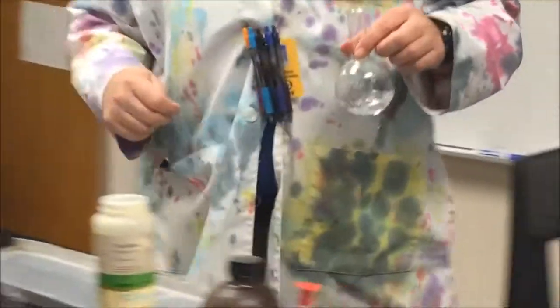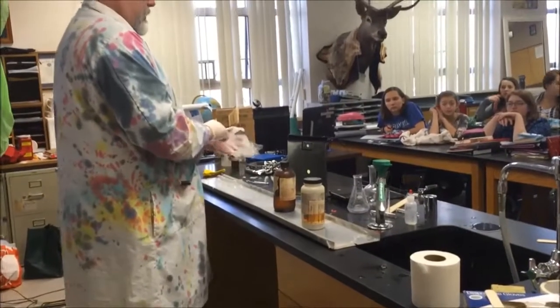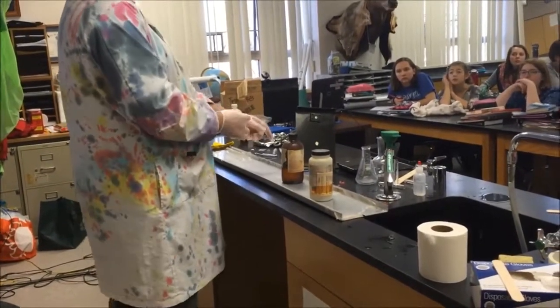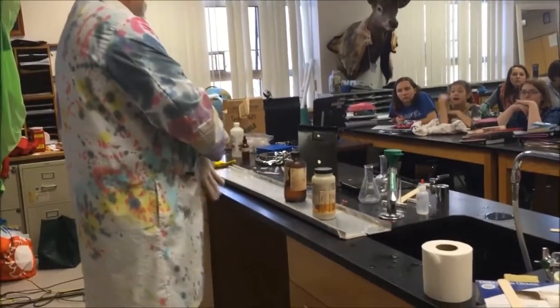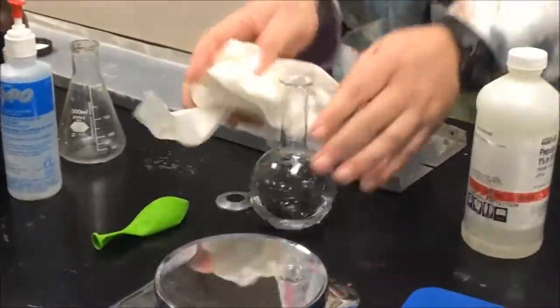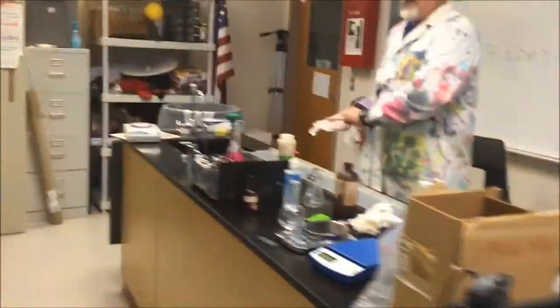The next thing I'm going to do is I'm going to add a really super duper ridiculously strong acid. Strong acid. Can I smell it? If you were to smell it, you should use what technique? Wafting. That's right. This stupidly strong acid is called hydrochloric acid. It's in your stomach. I have gotten like a full face of hydrochloric acid vapor — it was not pleasant.